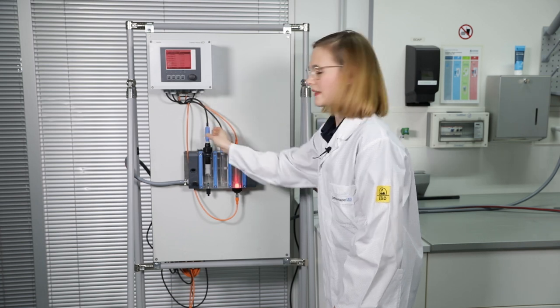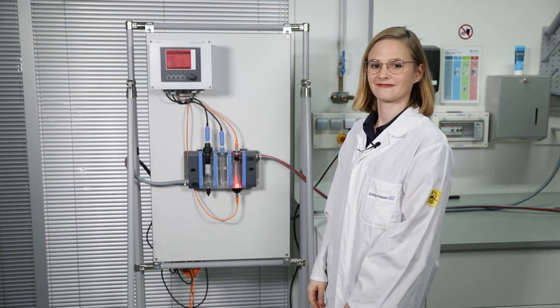So everything is configured correctly. That was my video tutorial on how to connect the status indication light and the flow switch of the CYA27 assembly to the Liquiline transmitter. I hope this video was helpful and if you like it, heart it!